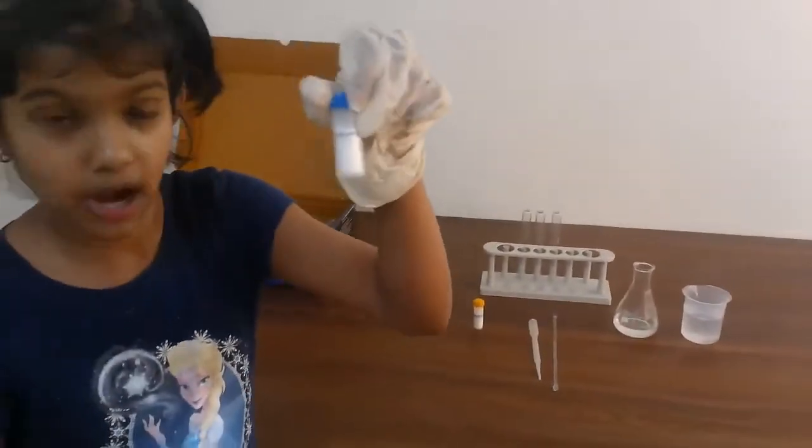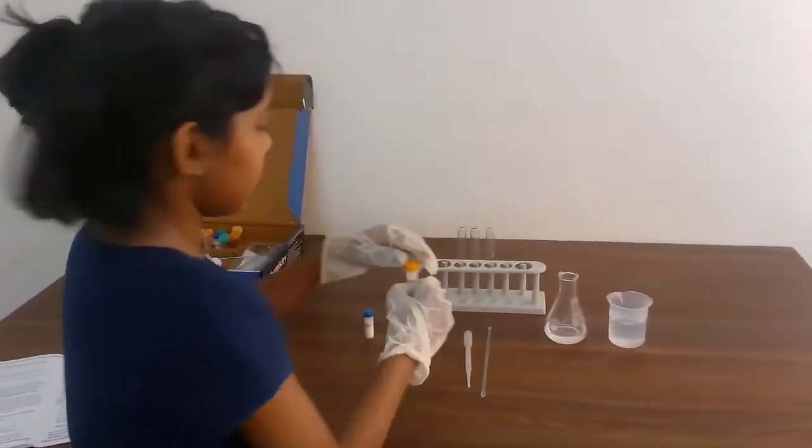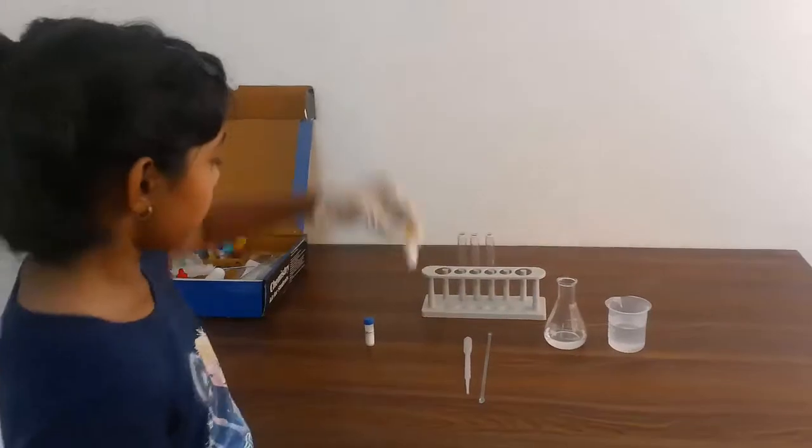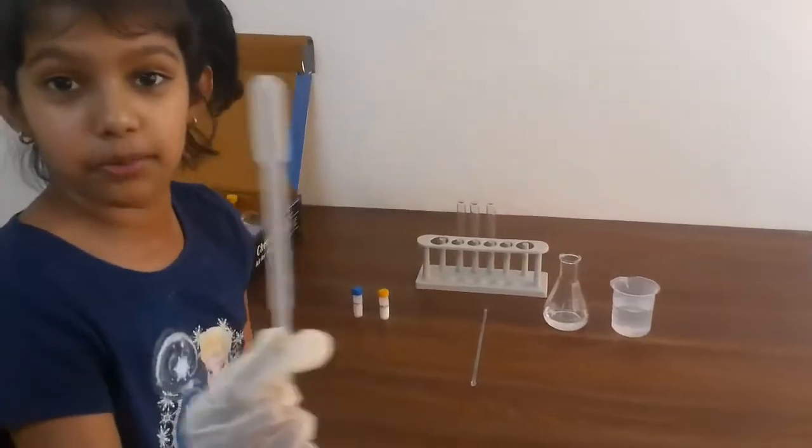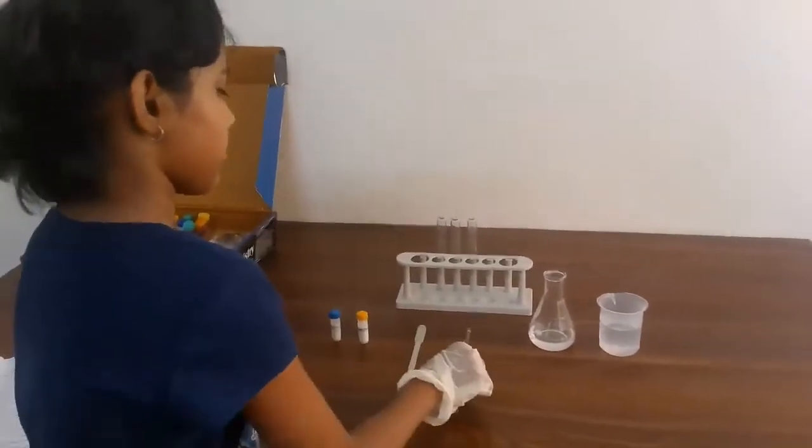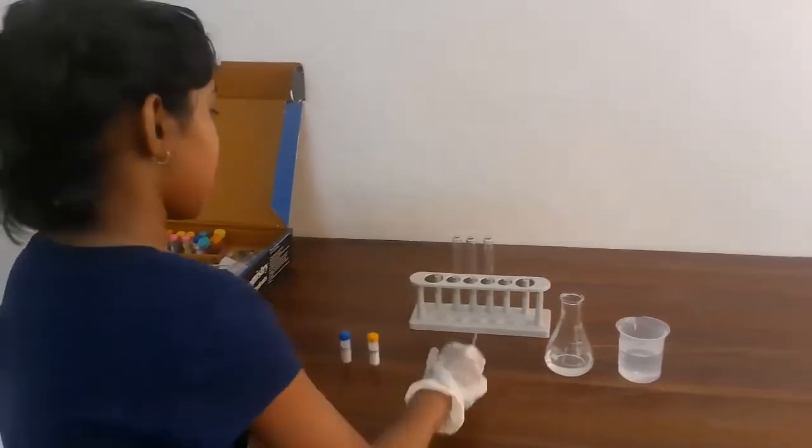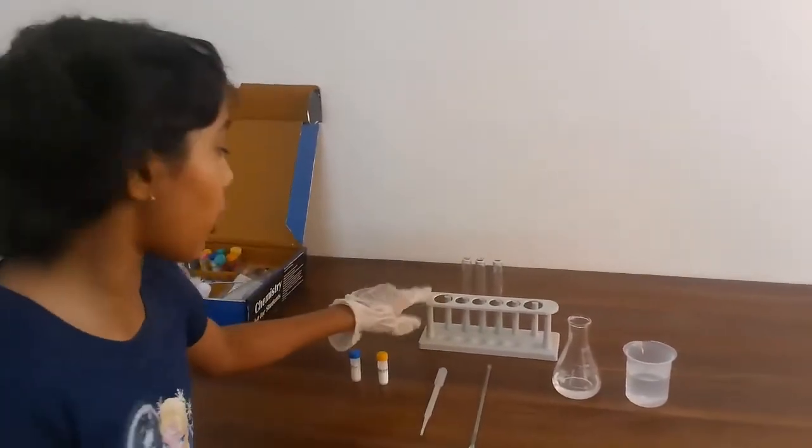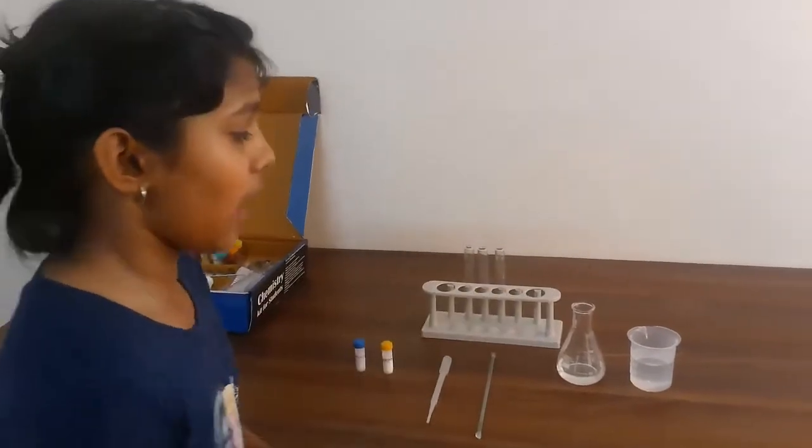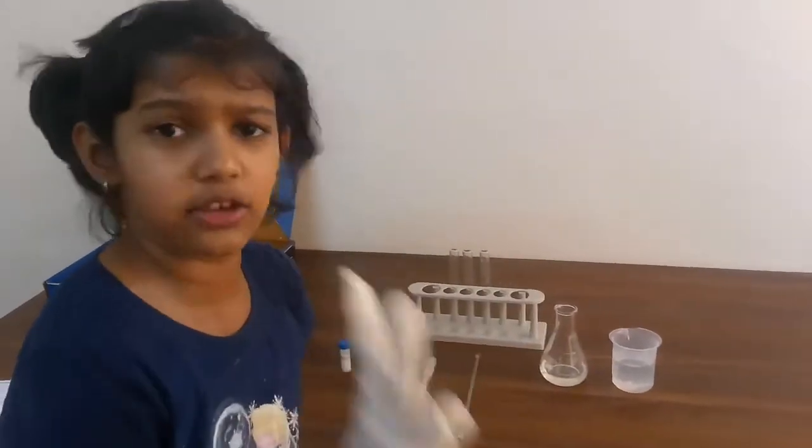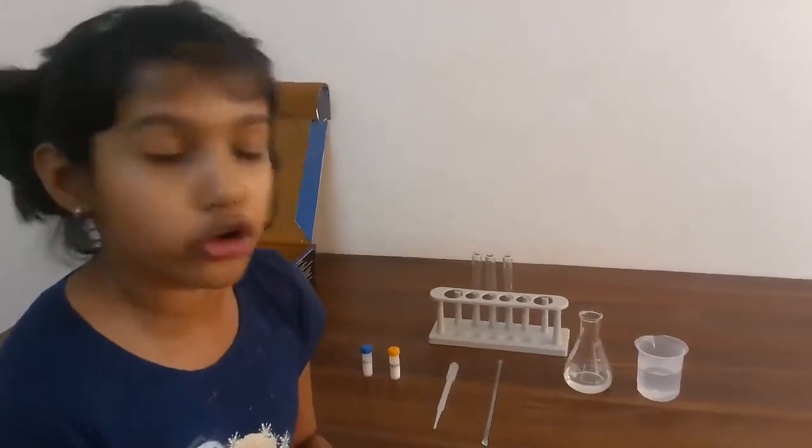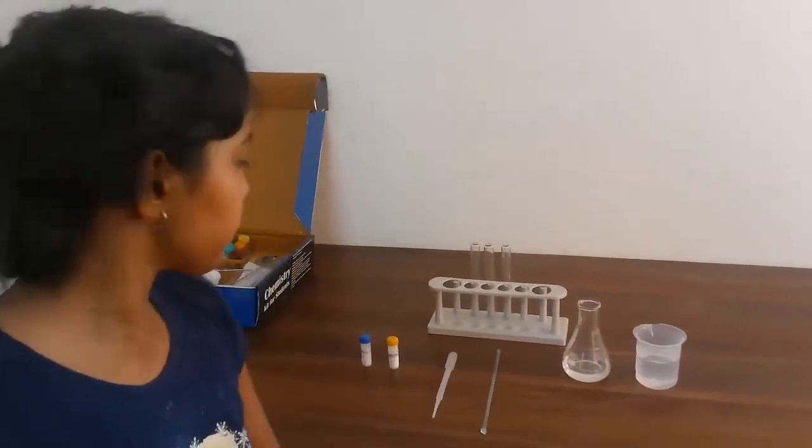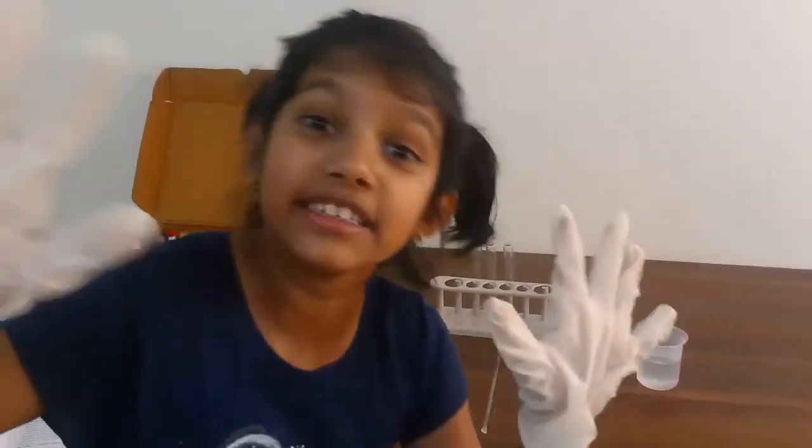So for this experiment you're going to be needing sodium carbonate, calcium chloride, a pasteur pipette, one spatula, two test tubes and something to keep all the test tubes in. I would also tell you to take two clean utensils with water in them as we're going to need it. And at last, gloves.